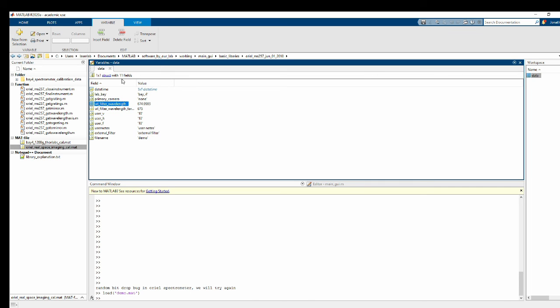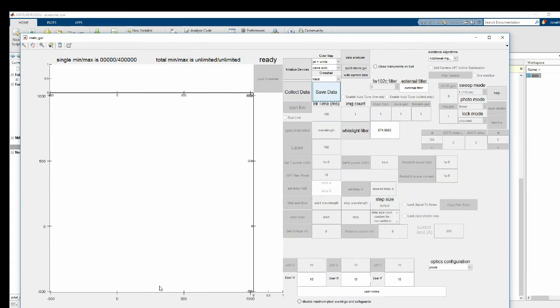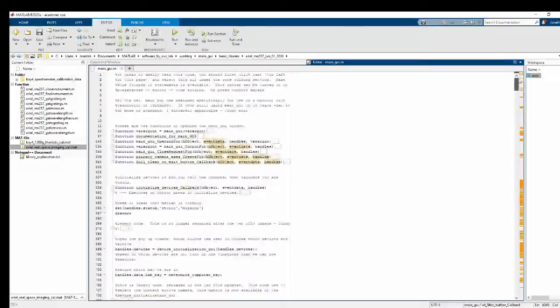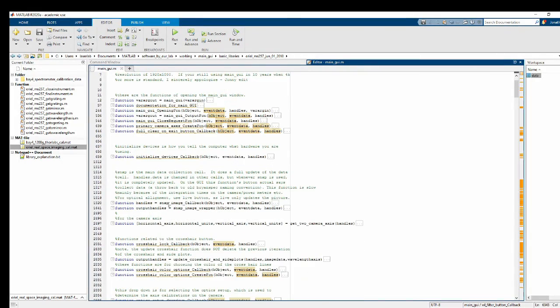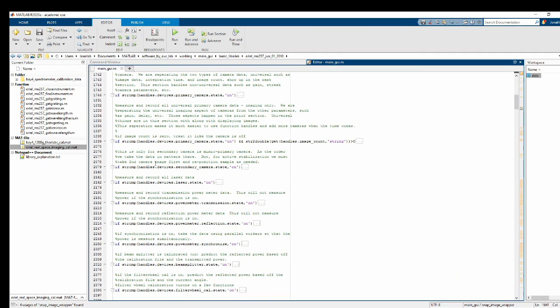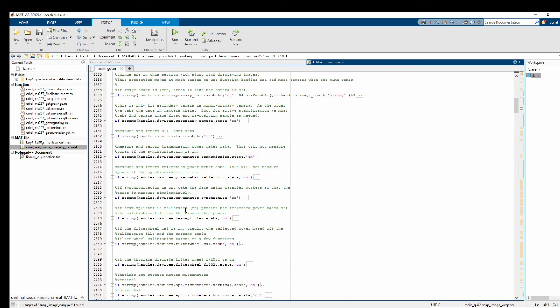But that's actually not enough on its own. We actually want to have it so every time you hit collect data, just in case something changed, it updates that field. So let's go ahead and find the collect data function. So every algorithm in main GUI is run through the snap image wrapper, basically. Really, they call snap image callback, which then calls snap image wrapper. And what we need to do is put in some code so that it'll check and update these stored values in the data structure. So let's find where the spectrometer is and put it somewhere close by to that, if we could.